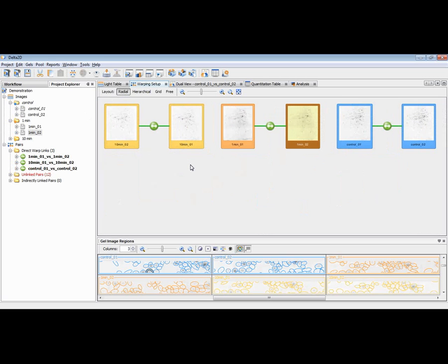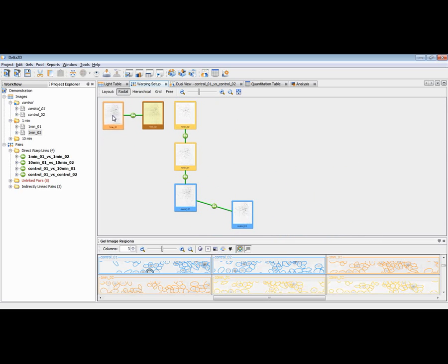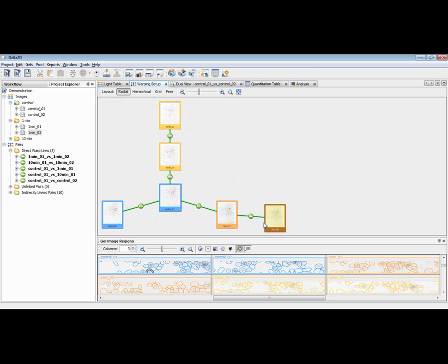Now they are connected already, and well, I have to admit that there is a preparation done. There are already warpings available behind it. That's why these bullets are green already. So now what we still miss is connections between the different replicate groups. Let us do this by taking the first replicate of the 10 minutes group and dropping it on the first replicate of the control group, like this, and also the first replicate of the 1 minute group, and warp it also to the first replicate of the control group, like this. Now we have connected all of them, and there is no image which is not yet connected to our graph and not bound into this warp graph.